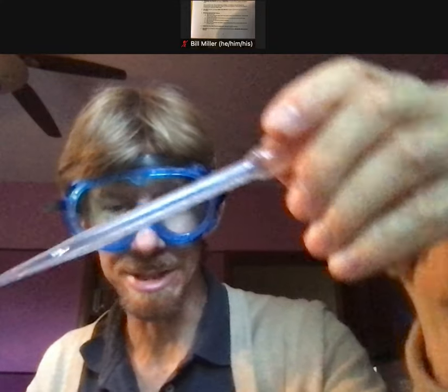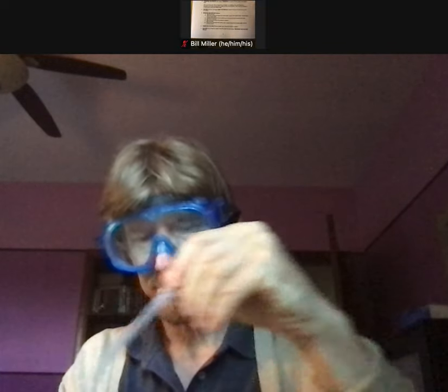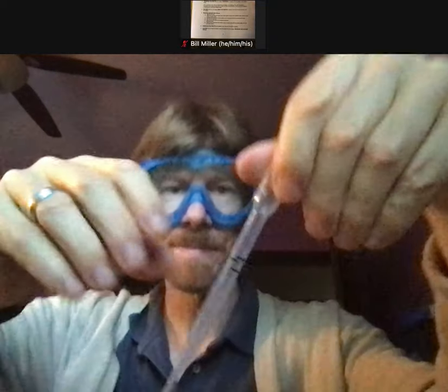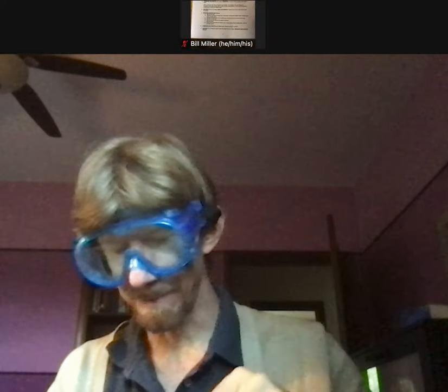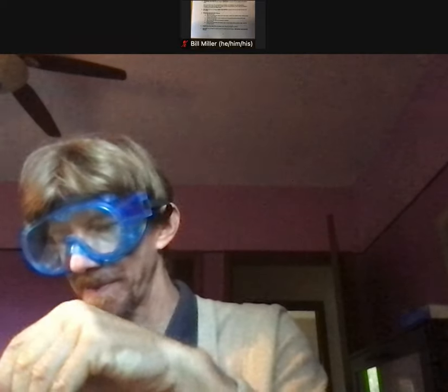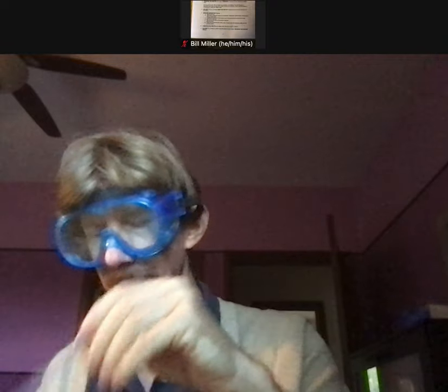I've got my waste here. You can actually see I've been using my pipette recently, so it's not clean and dry — we would need to condition it anyway. I'm going to squeeze it out, suck up just a little, get it all over. That's one. This is my calibrated pipette — you can see it's got its lines on it, and the second from the top line is my two milliliter line. That was three times.